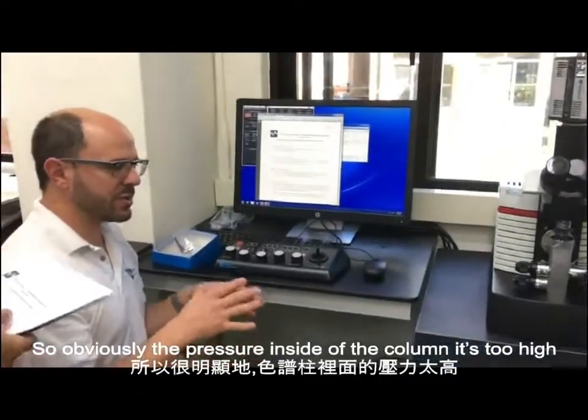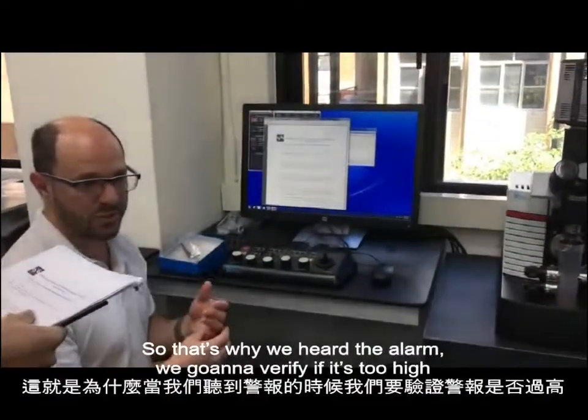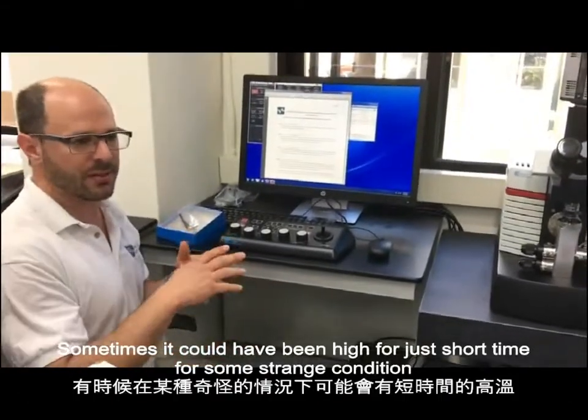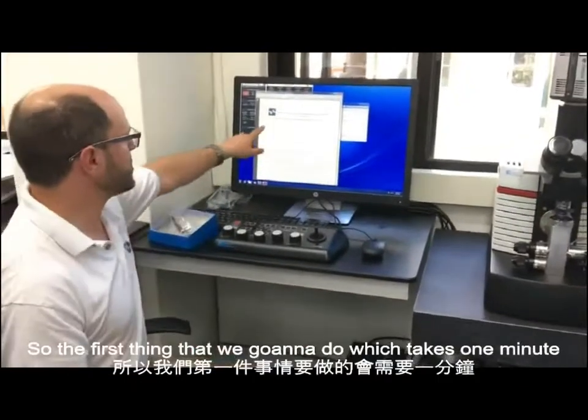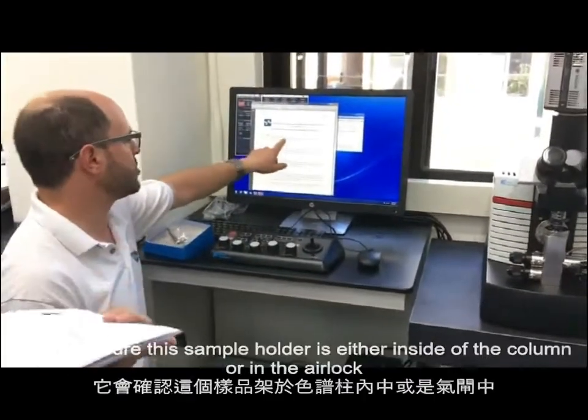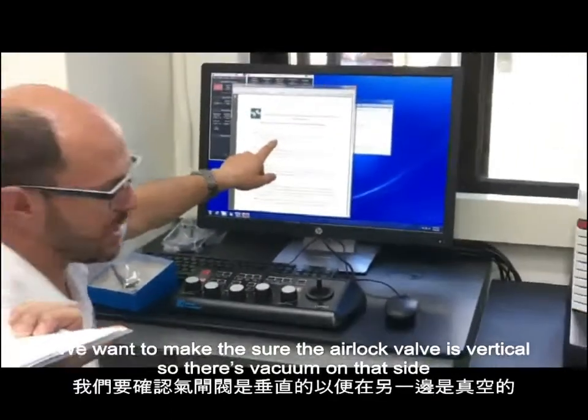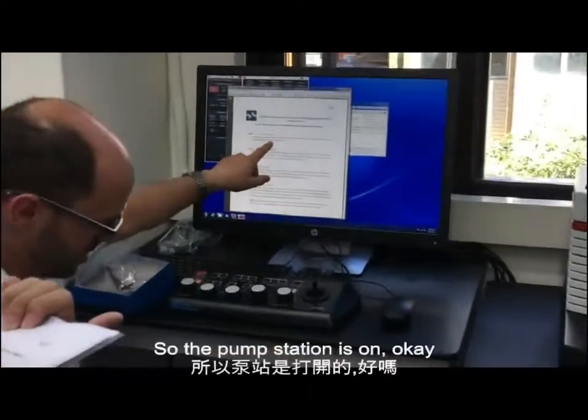Obviously the pressure inside the column is too high, so that's why we heard the alarm. We're going to verify if it's too high. Sometimes it could have been high just for a short time, for some strange condition. So the first thing that we're going to do, which takes 1 minute, is make sure that the sample holder is either inside the column or in the airlock. Okay? We want to make sure that the airlock valve is vertical so that there's vacuum on that side, so the pump station is on.